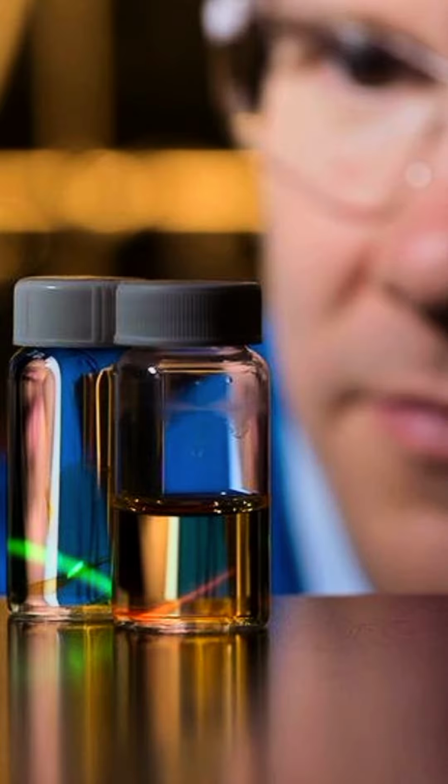Now you know how to carry out chemical analysis. Which one do you want to try? Do you want to check if it is really sodium chloride that you are using, or sodium carbonate, or any chemical product that you are using? There is always a chemical test for it. We'll talk more.